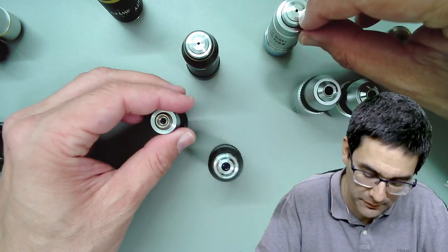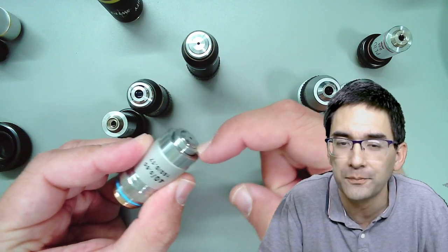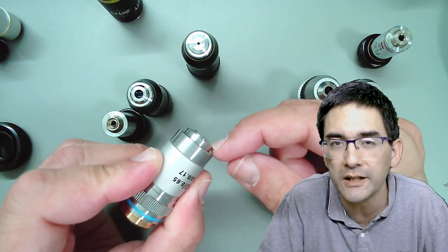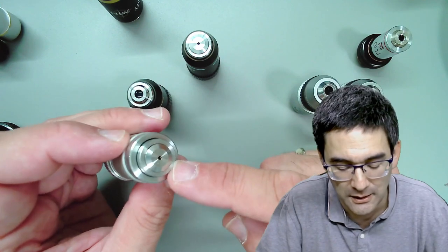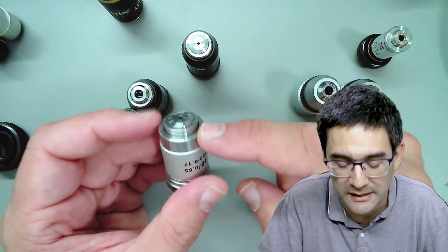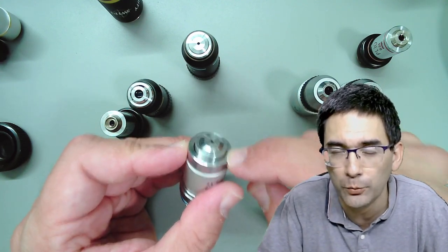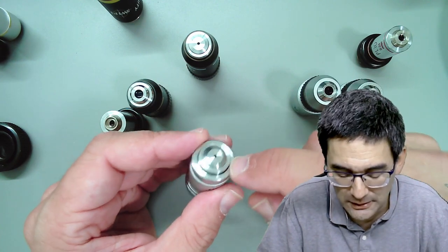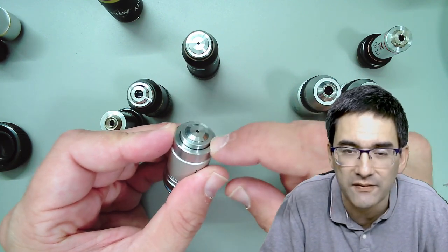Another feature to point out: this front part is a so-called spring-loaded objective. This is a protective feature - when you crash the objective into the slide, the front part of the objective retracts, protecting the front lens and your specimen slide. It's nice to have, although ideally it shouldn't happen at all. Be careful also when cleaning objectives: there is a gap on the side of spring-loaded objectives where liquid can run in, so don't clean unless really necessary.